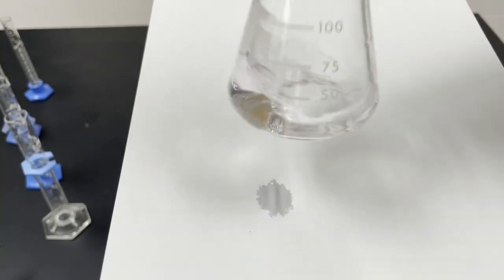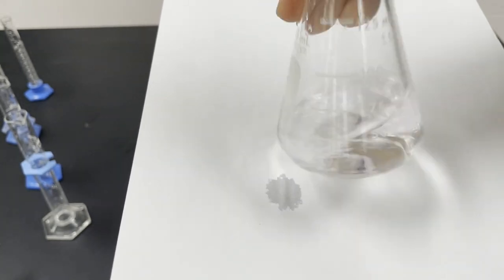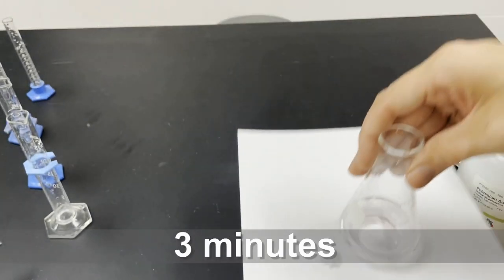This one, however, is very similar to the control, so not much of a catalyst at all. There we go. I think that's good.